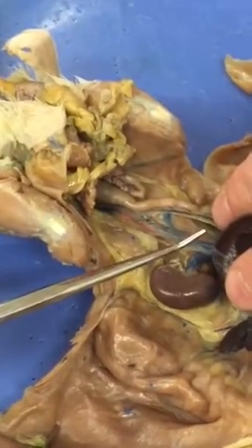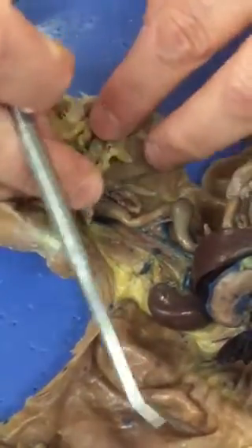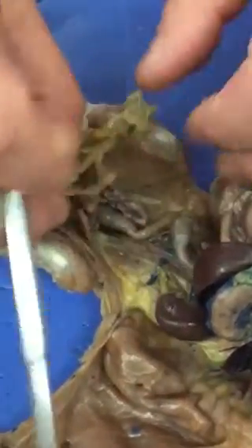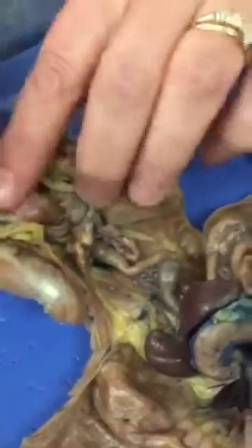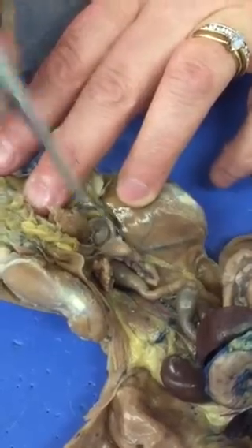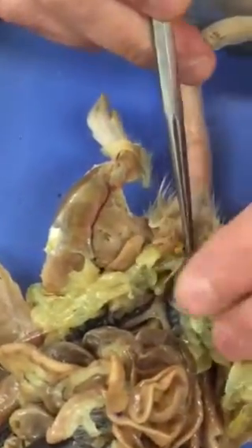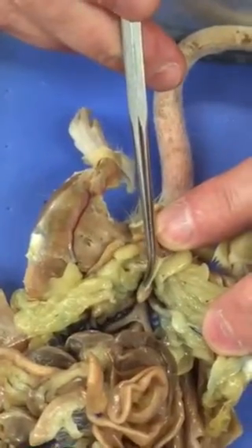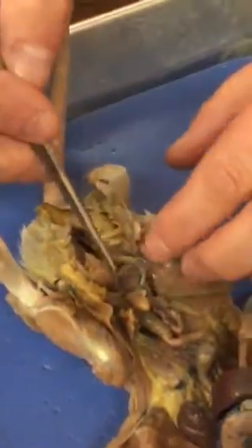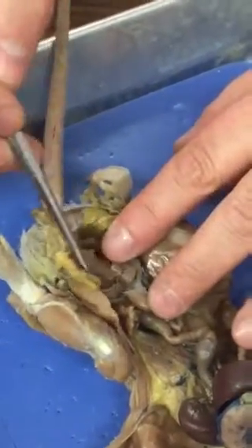That is the ureter. Now the bladder is easier to find in a female than a male because of the seminal glands that surround the bladder. But this is the urinary bladder in a male, and this is the urinary bladder in a female. Urine drains out of the bladder through the urethra. To see that, we would have to truly crack the pelvis, which I won't do.